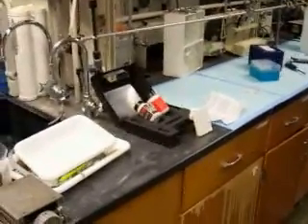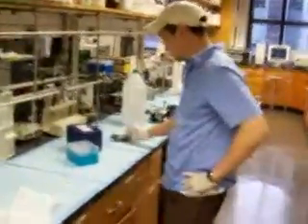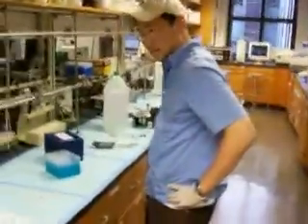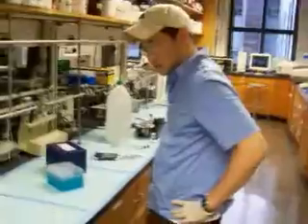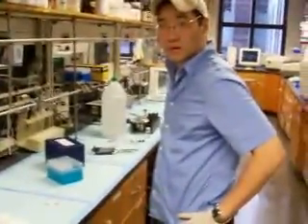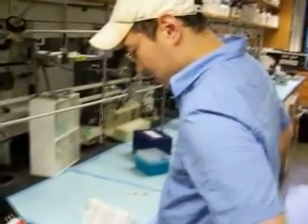We are live in the Whitesides Group bio room with Professor Andrew Lee, who has noticed a mercury spill that has been left unattended without being reported. And we're taking the necessary steps to rectify the situation using a proper mercury spill kit, which Professor Lee is going to explain how to use right now.